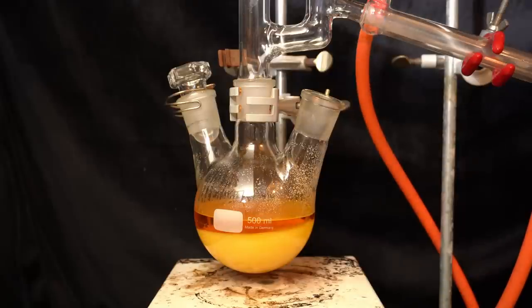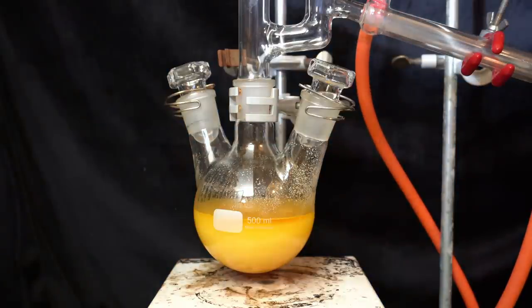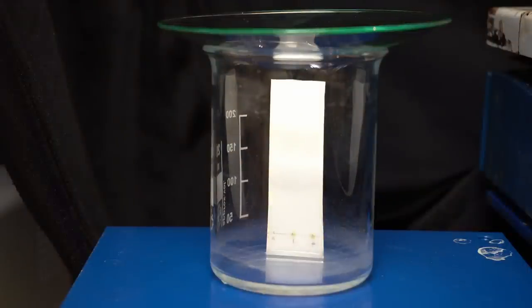Therefore I add some additional methyl iodide to the flask in order to push the reaction to completion. The amount isn't super important, it's around 10 milliliters. After two more hours of stirring I perform another TLC. The aniline spot has now completely disappeared. There's still some of the presumed monomethyl product there but I'll stop the reaction at this point.